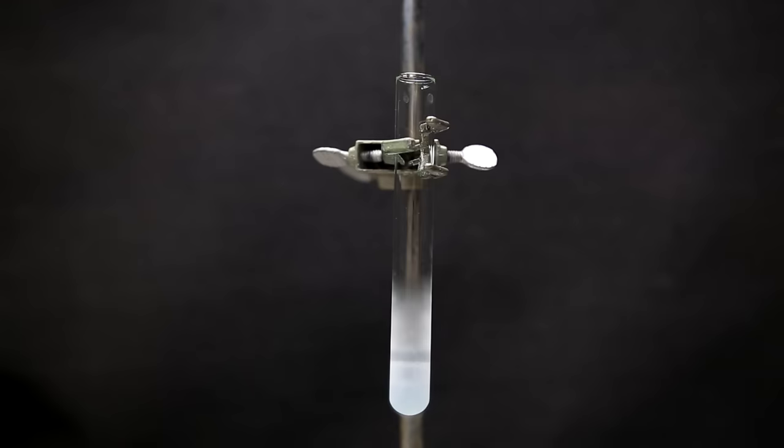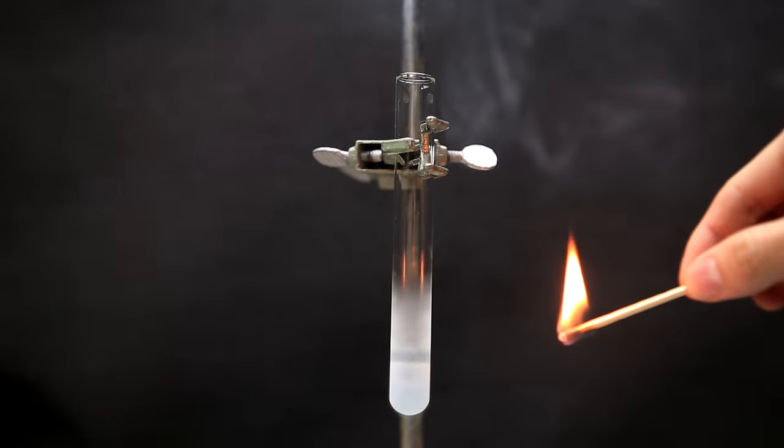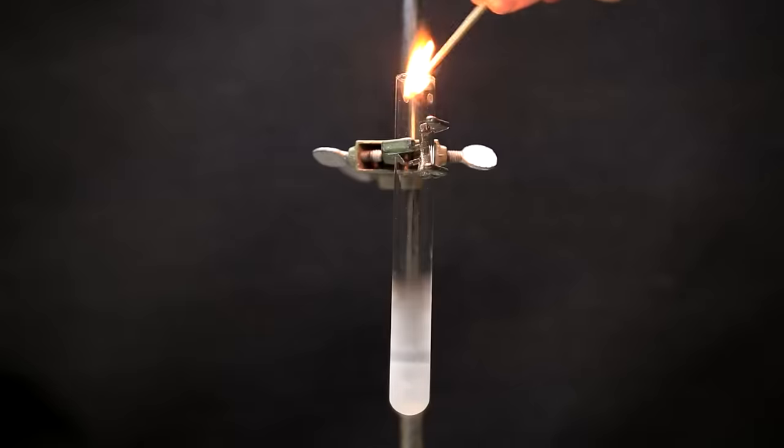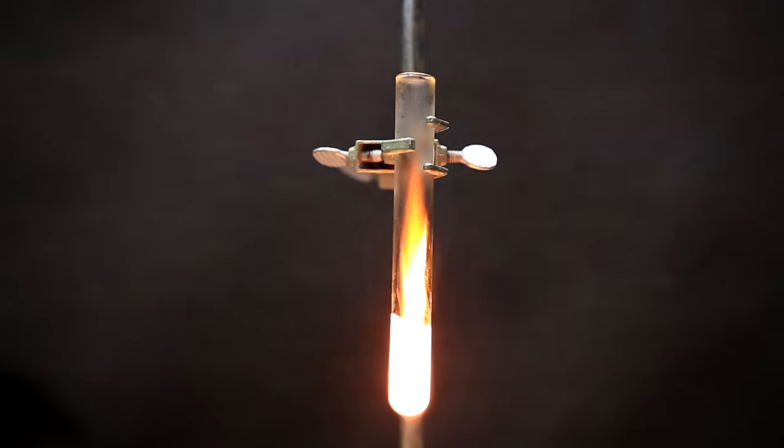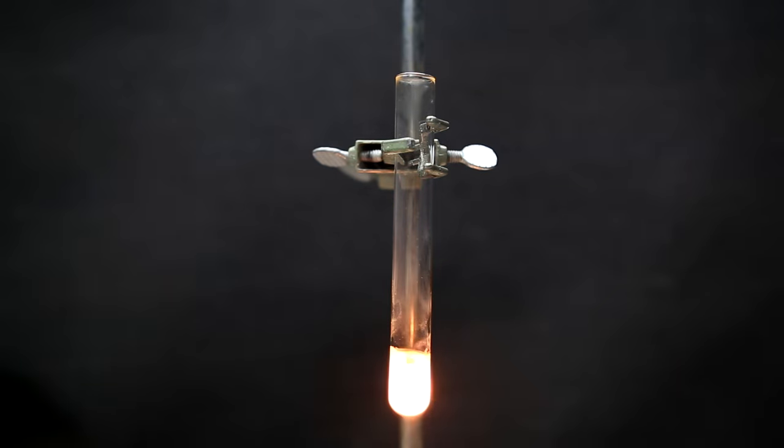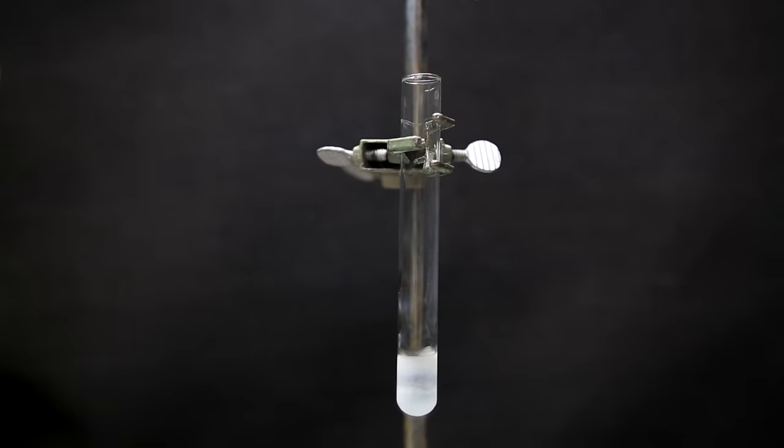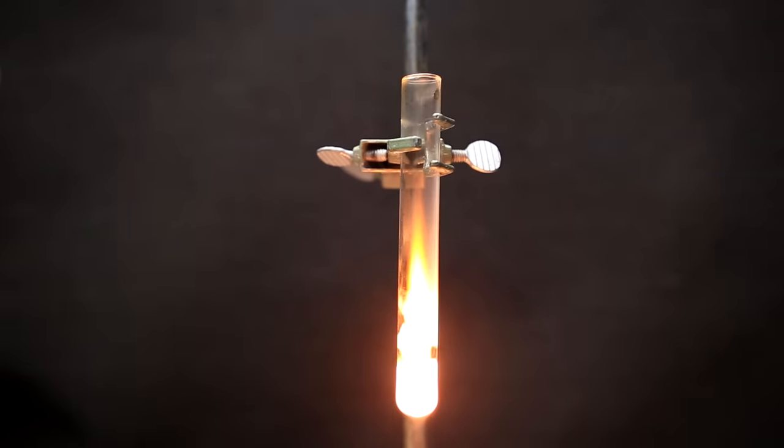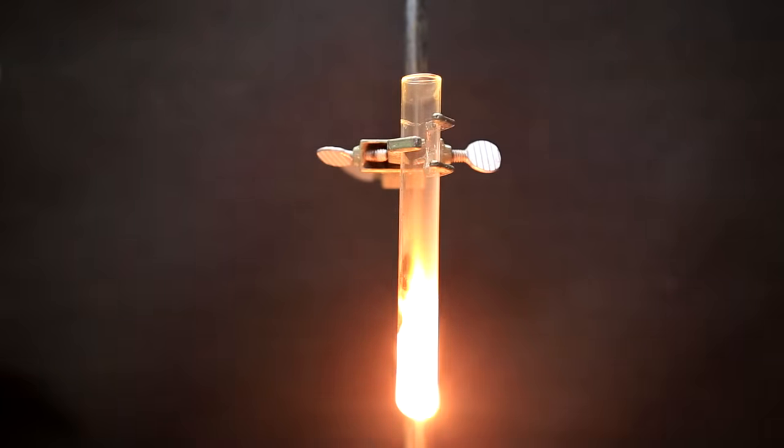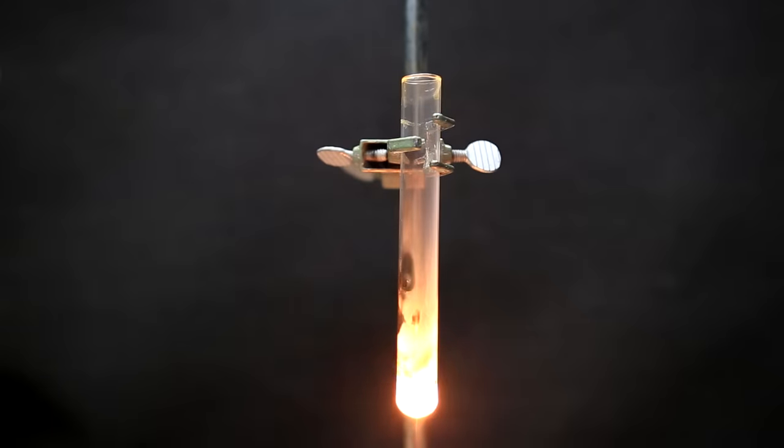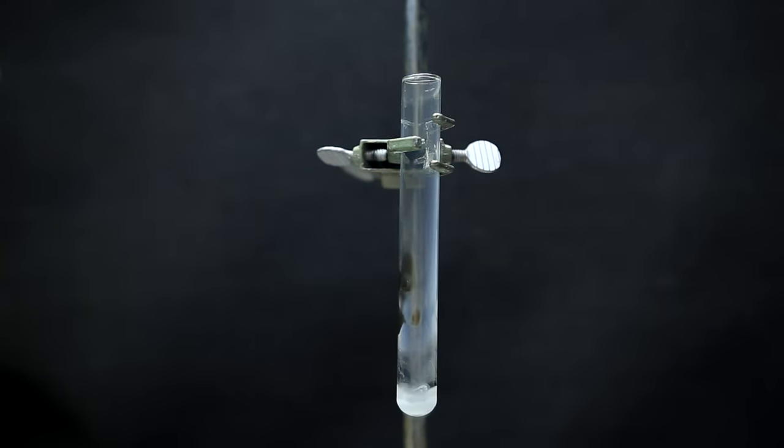And then for the second classic experiment with liquid oxygen is we drop a flaming match into it. When the match is near the opening of the tube you can see it burns brighter due to the oxygen. When this match is dropped in it will also burn until it disappears. This can be done over and over again until there's no liquid oxygen remaining.